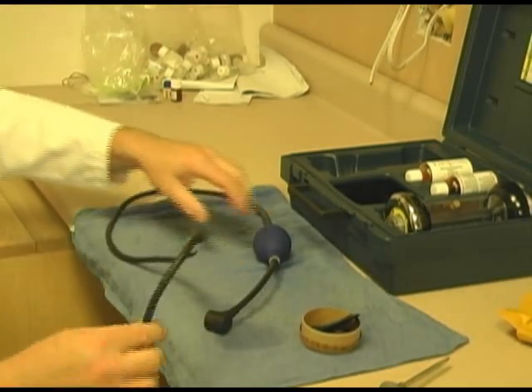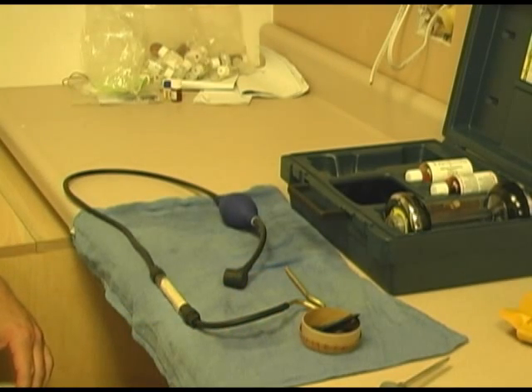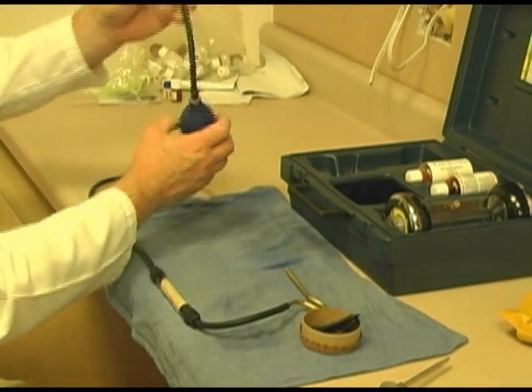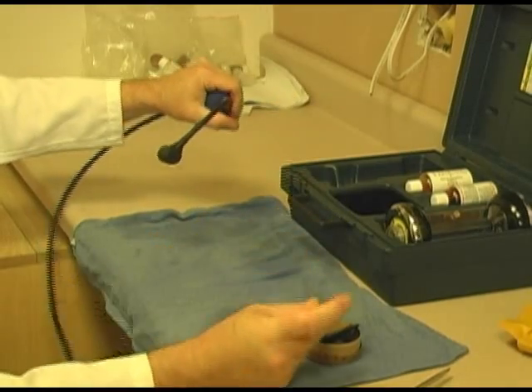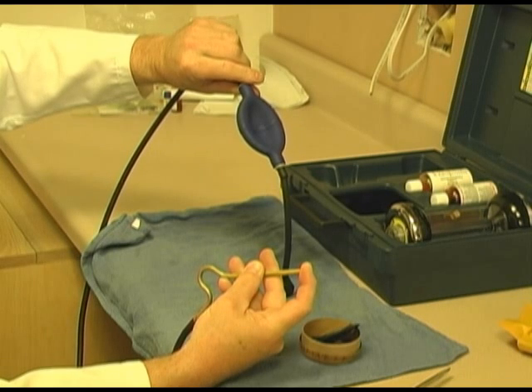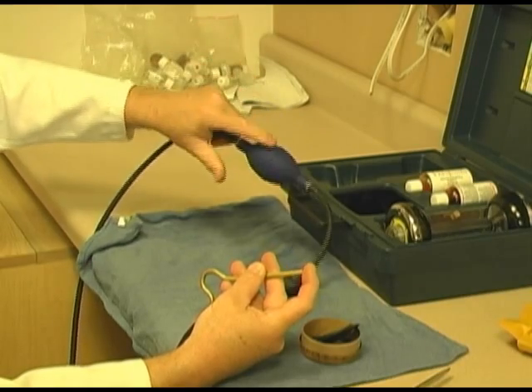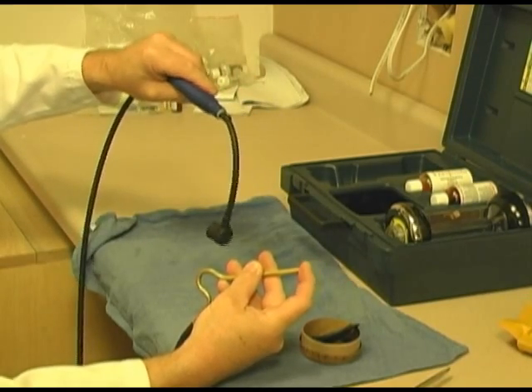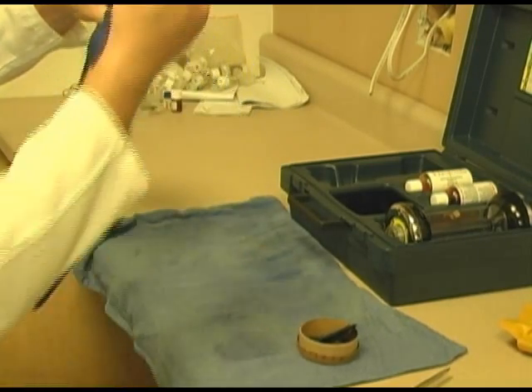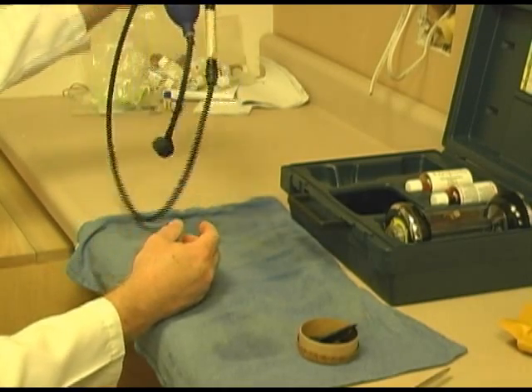This is the hose that generally you use to take a sample from an incubator or some other device. First, we're going to show you how to check this to make sure that it's operating. Simply by holding one end with your finger, plug in the end. You see my bulb should stay collapsed. If it had a leak on it, which I'm going to simulate, it comes out. As long as this stays flat, when you put your finger in and block the output, all this is sealed and it's working well. And that's all the maintenance that is required to this, which is simply replacing this cloth, which you'll have plenty of cloth by the time you do this once or twice.